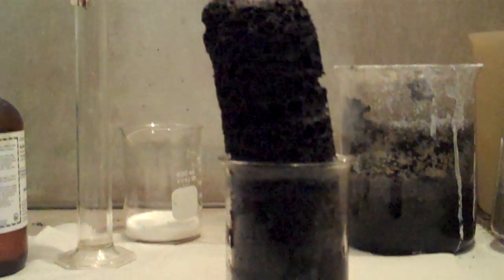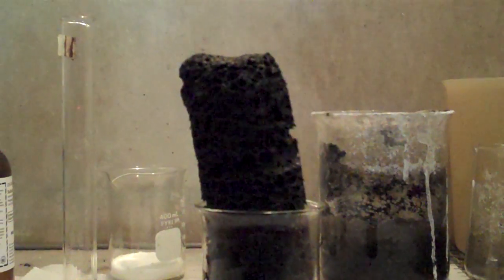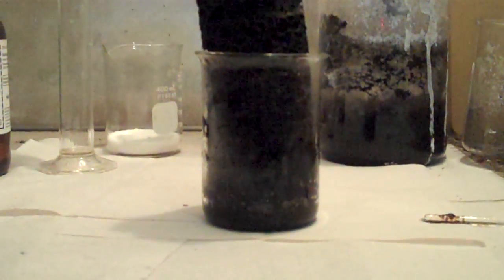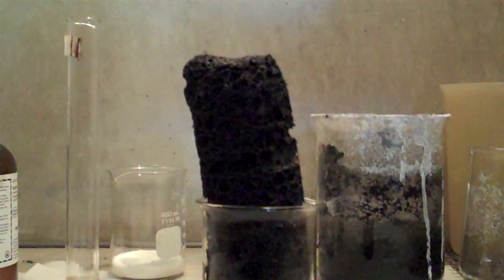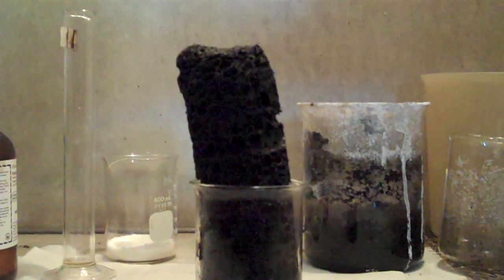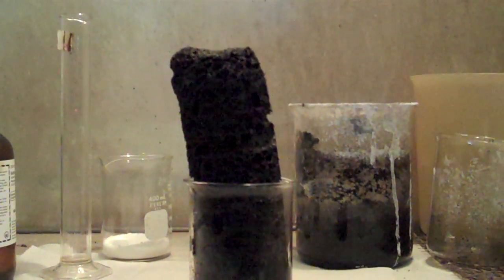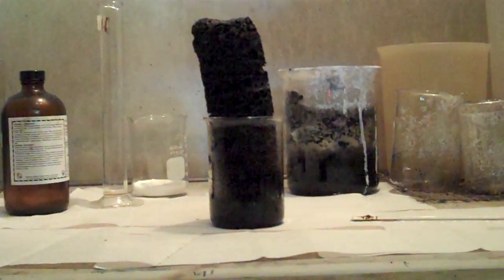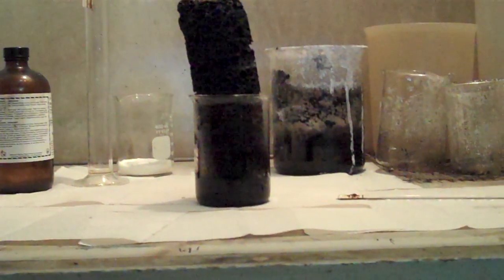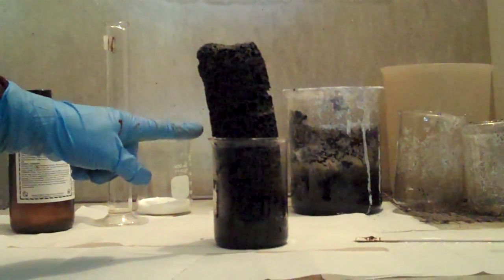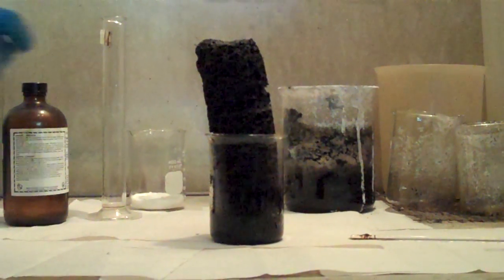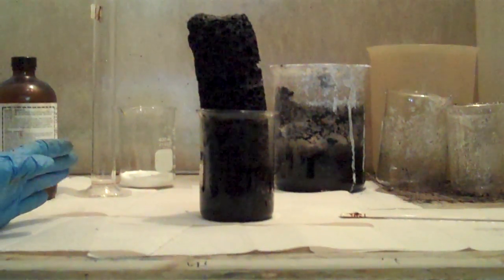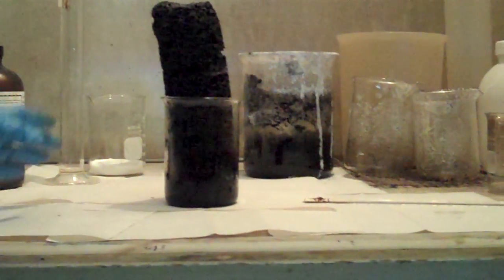No, you can't touch it because... Why? Does someone remember what the catalyst was? Sulfuric acid. Sulfuric acid. What happens to a catalyst during a reaction? It disappears. Disappears. No. What happens to a catalyst? It doesn't get used up. So it'll still be there. That 18 molar sulfuric acid is still in that carbon. So no. Can we touch it? I would recommend that you did not touch this at all.